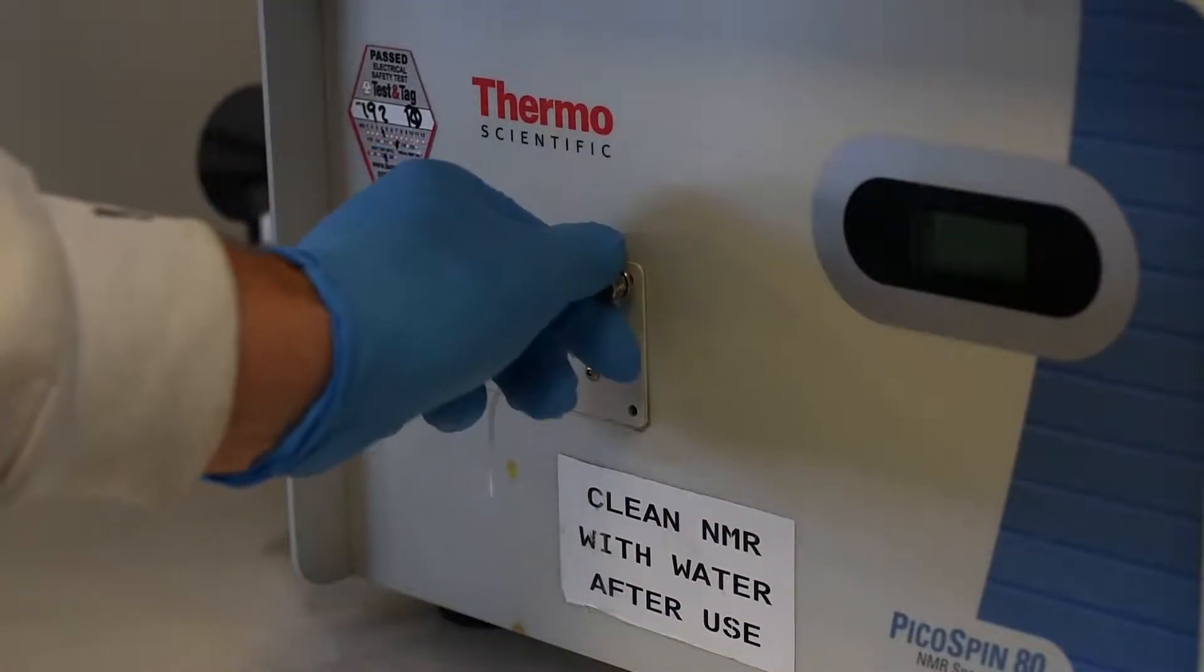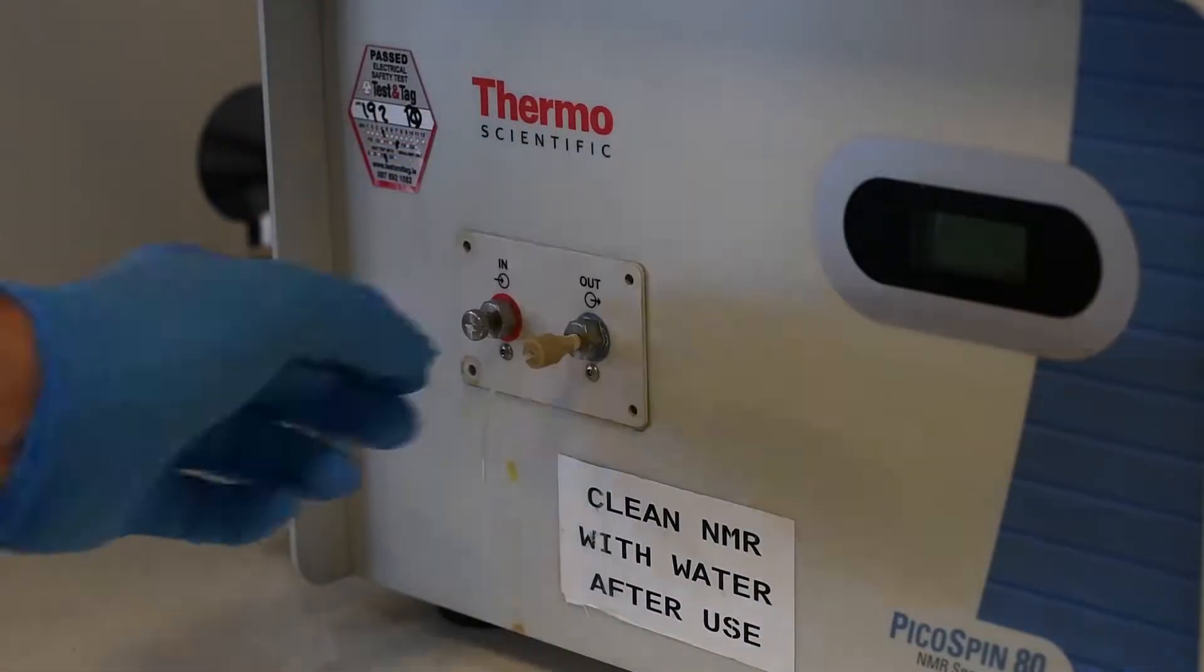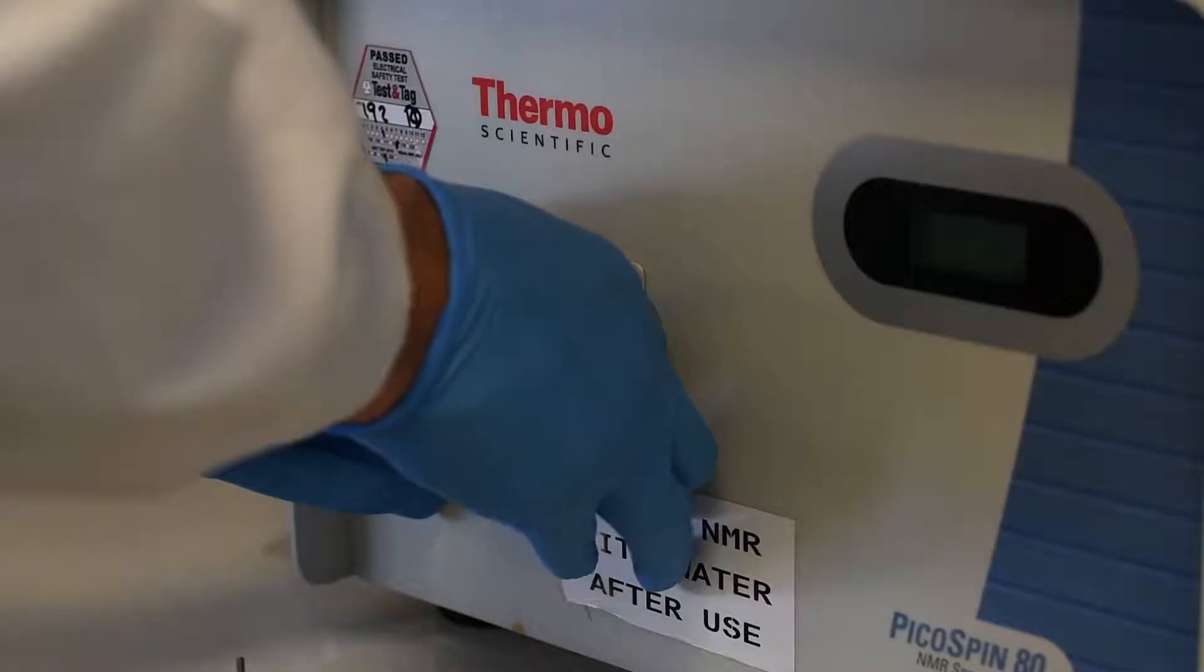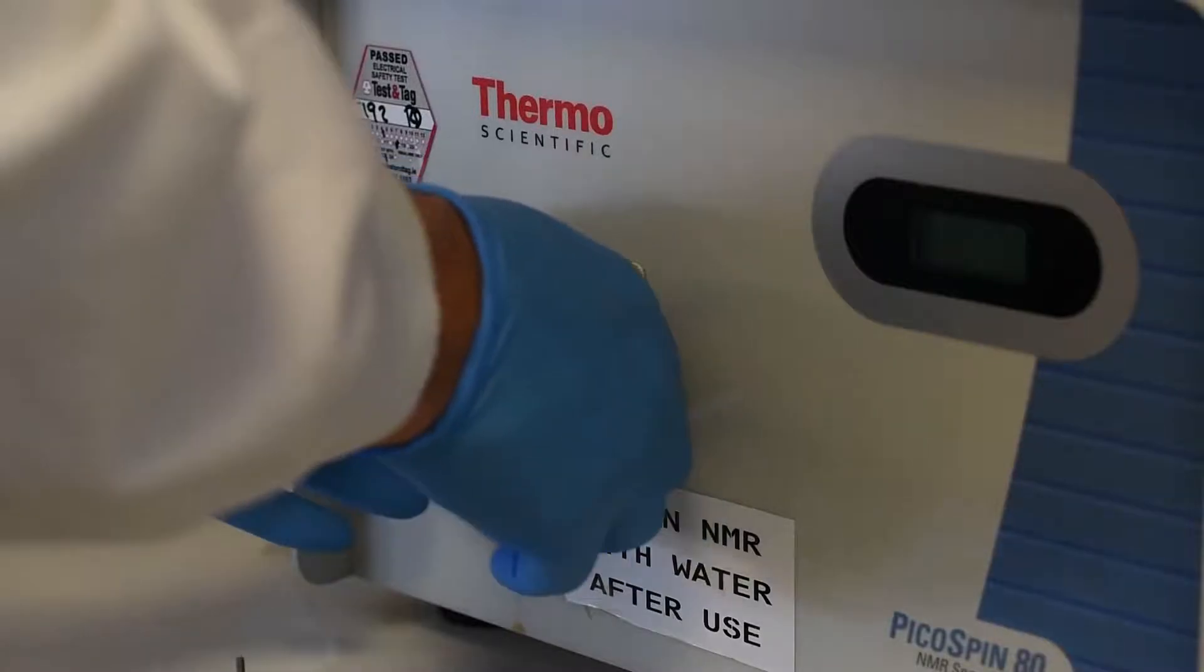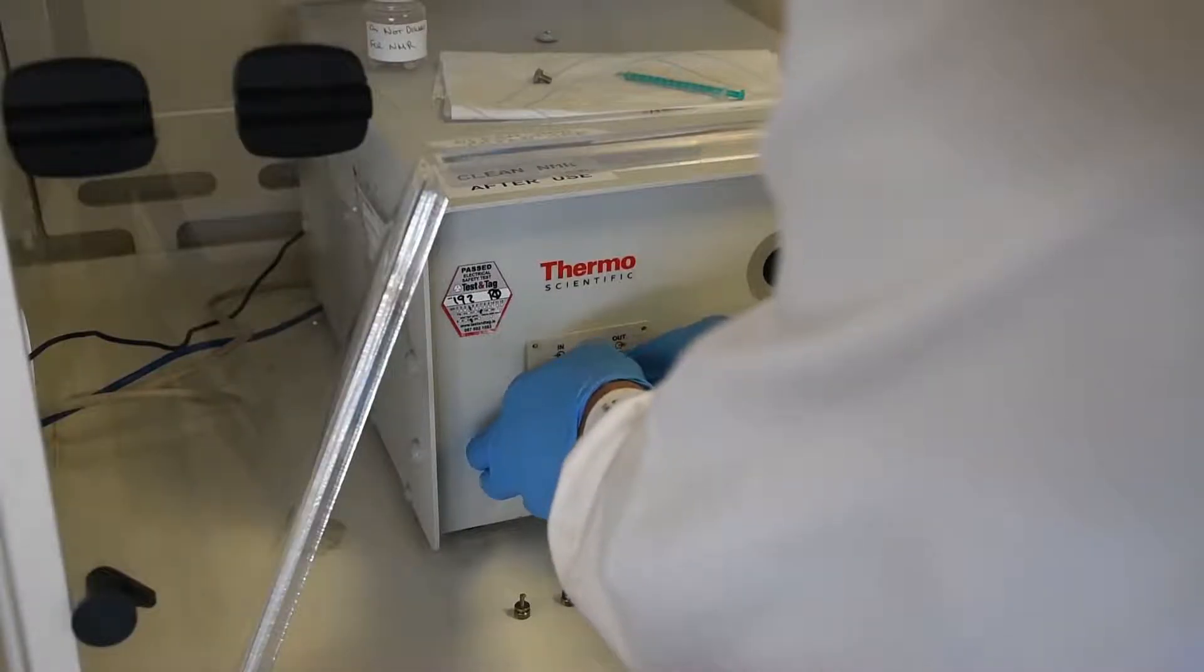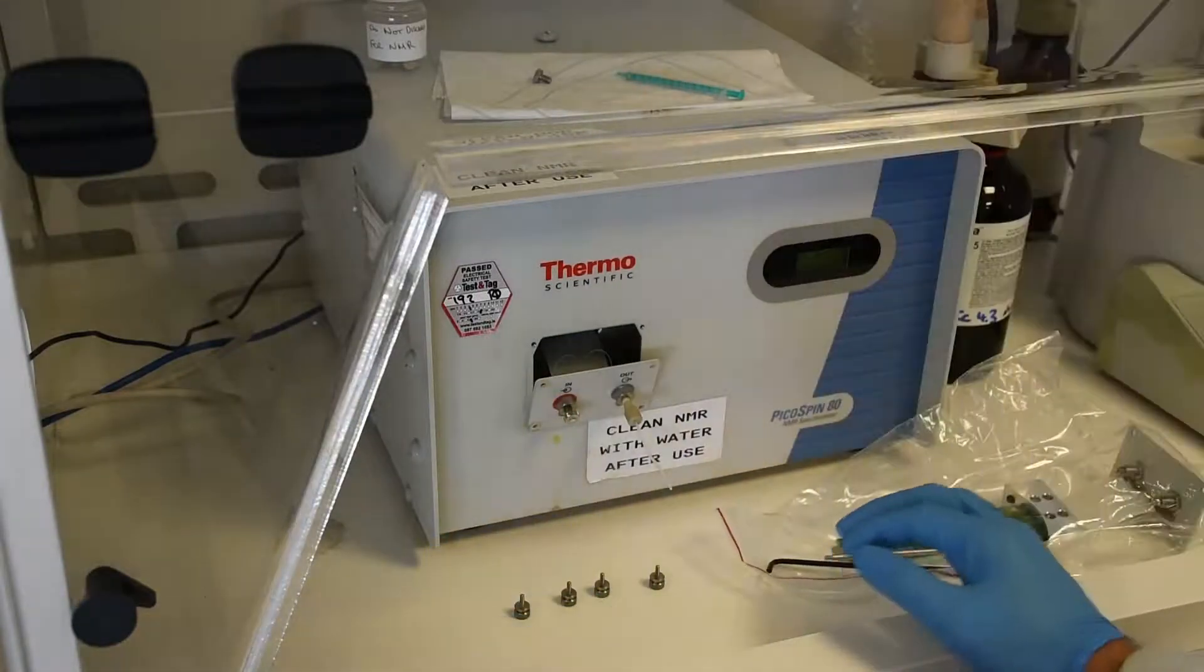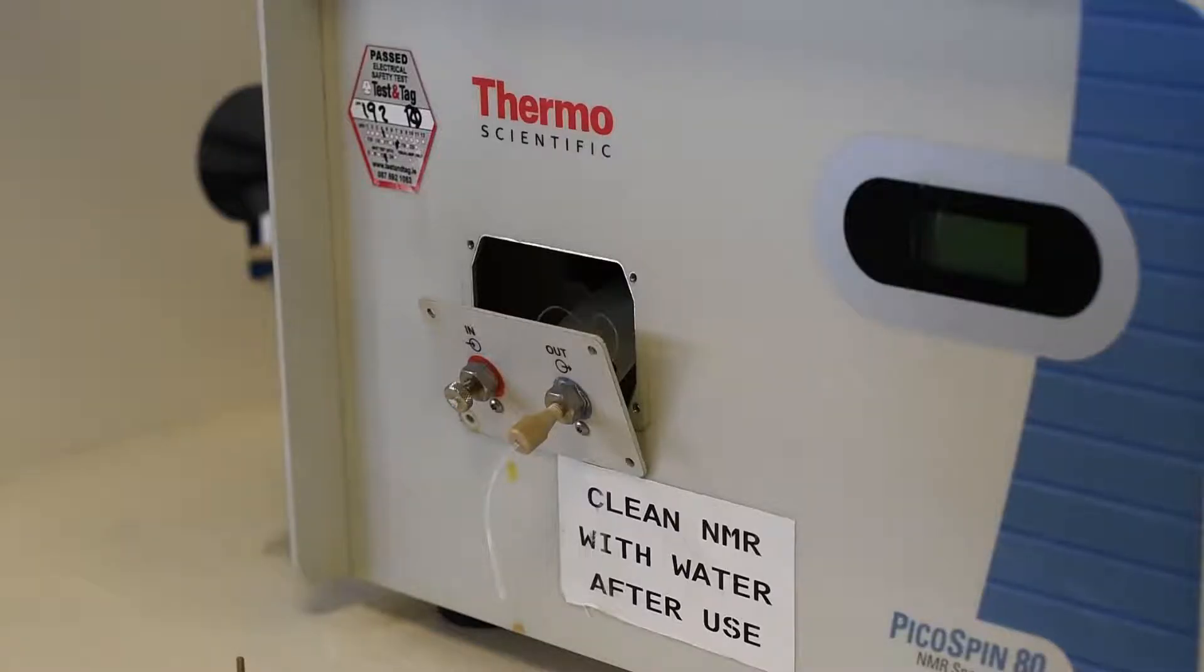Again, it is important to do this quickly so that you are not having dust flow in and out. Once you have done that then you can remove this. It may be stuck a bit in place so it may take a small amount of force but it shouldn't take too much force. If it takes too much force then just check that all the screws are out and that it is not glued in place by some kind of dirt.